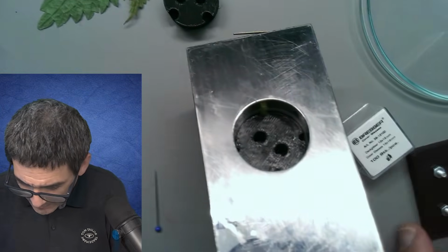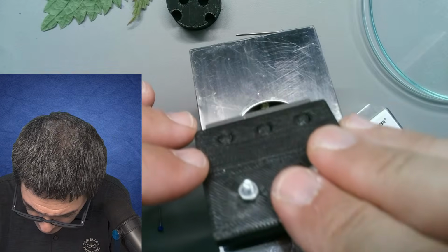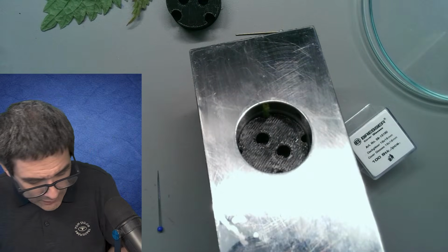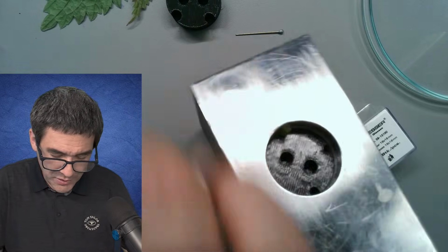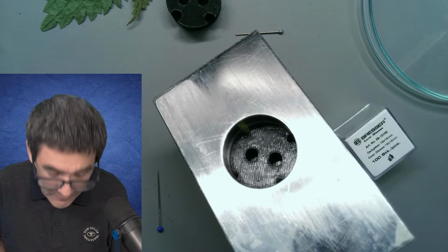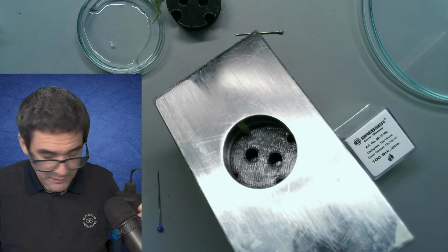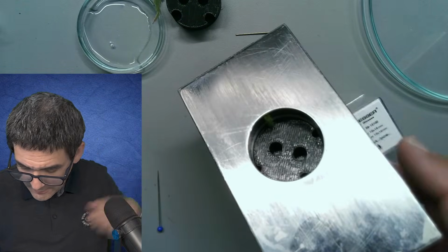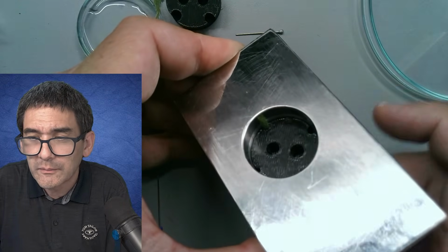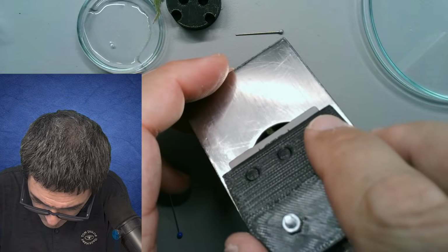I need my sharp knife, and let's see if the first cut is always a problem. I see it's a tiny amount. And I need also a little bit of water because those cross sections dry out very quickly. So the water is up here. And then, let's see if I'm able to get this here.